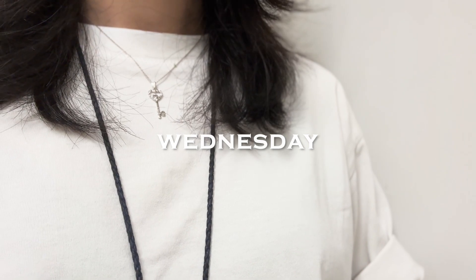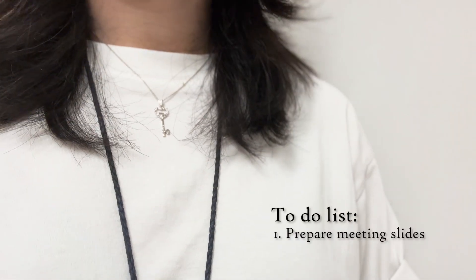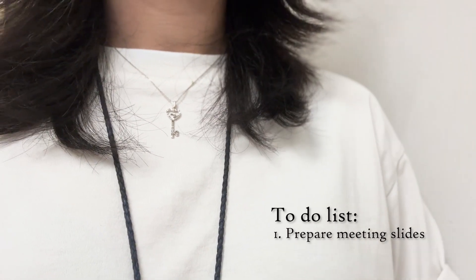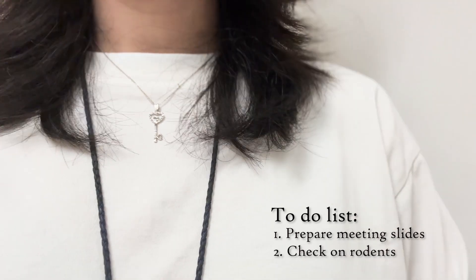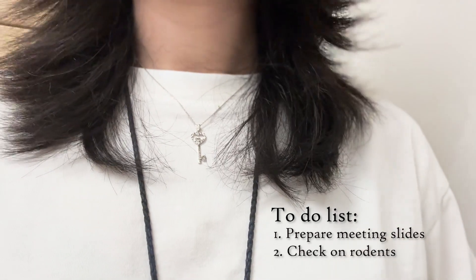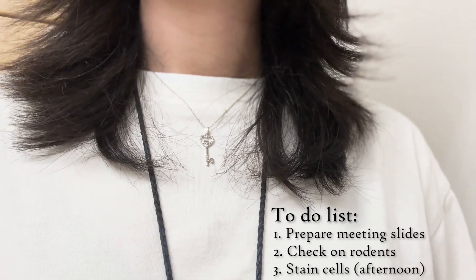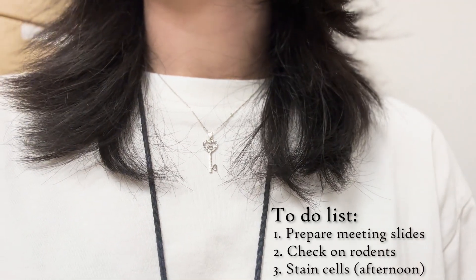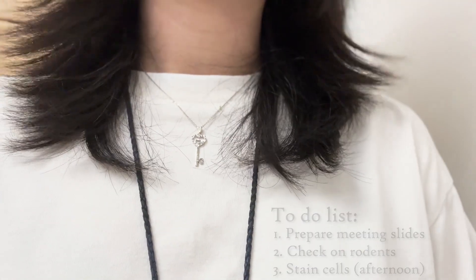The plan for today is to first prepare my meeting slides with my professor later, and then afterwards I think I might pop by the animal house to just check my rodents. Also, in the afternoon we're going to do some staining for my cells, so tomorrow I'll be harvesting these cells and then checking the fluorescence using flow cytometry.